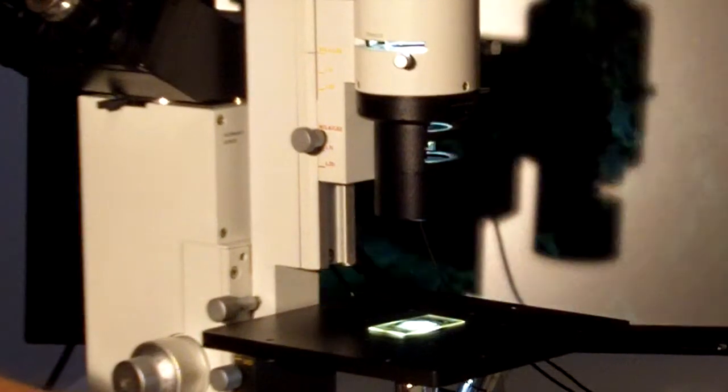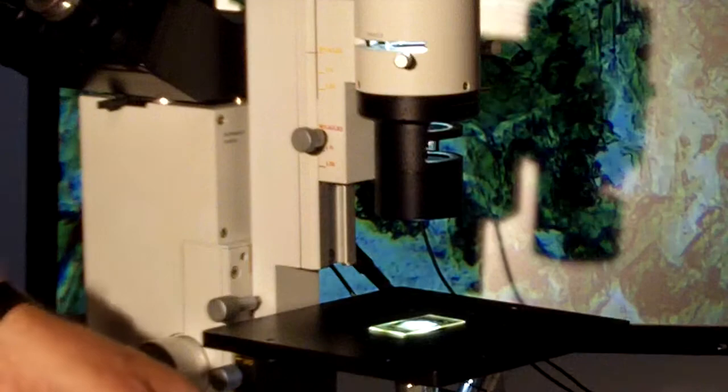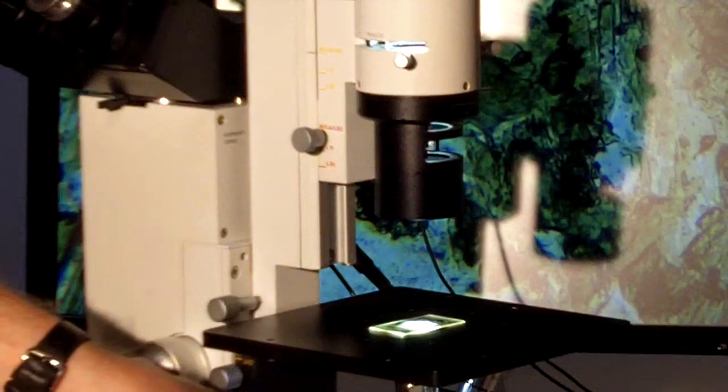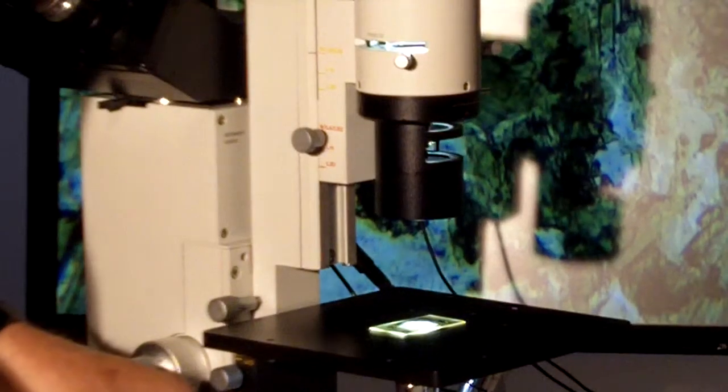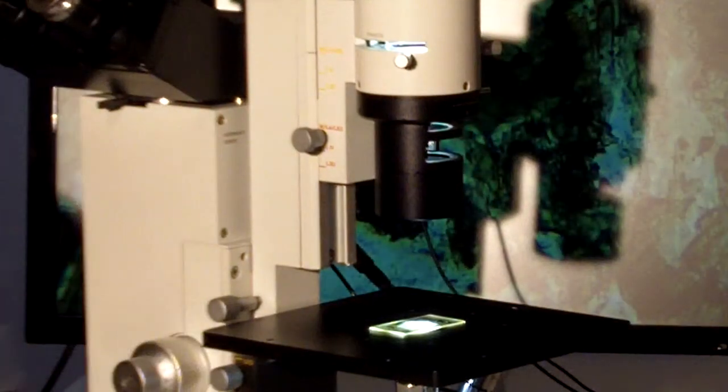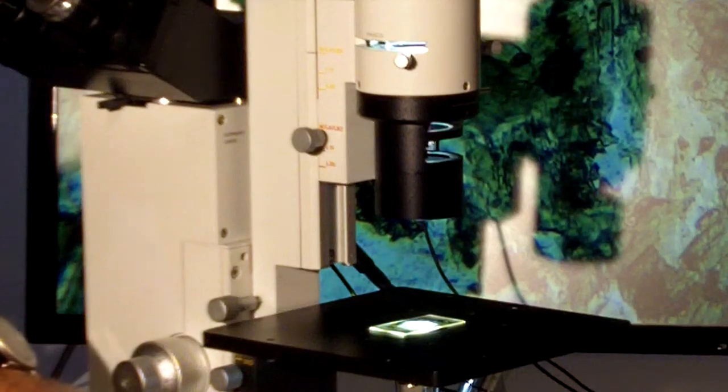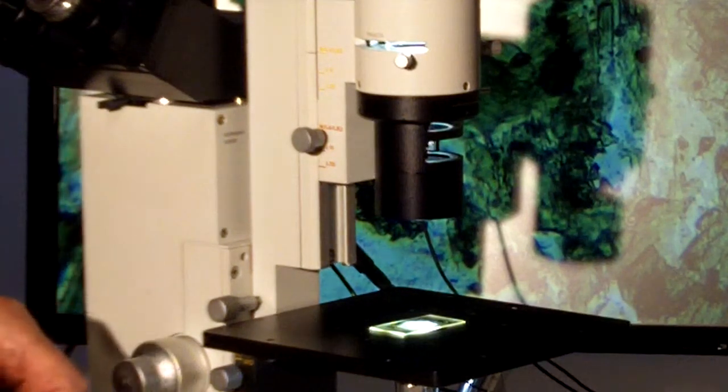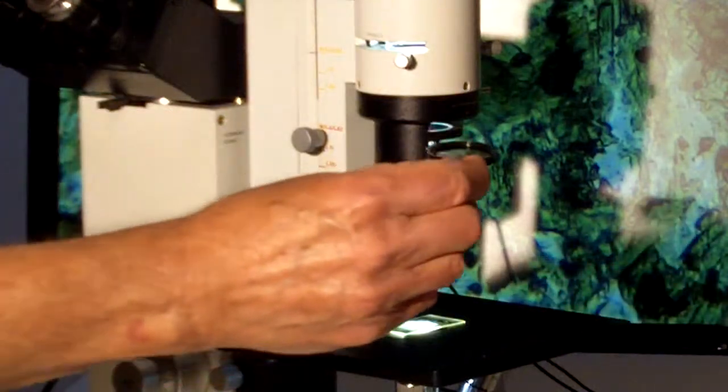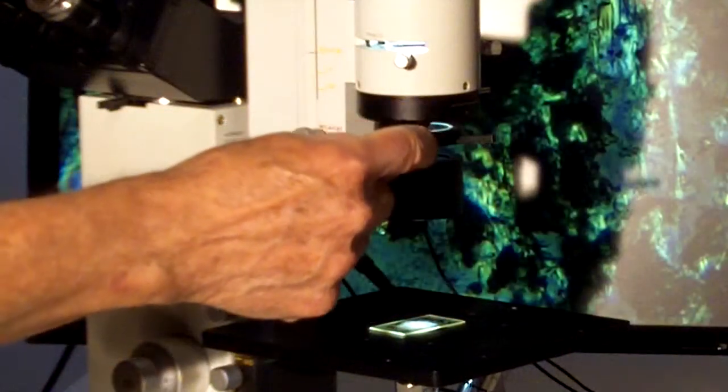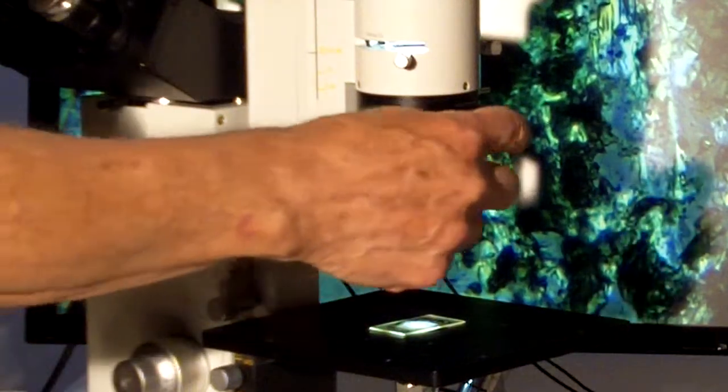Now the way we get cross polarization is to add what is called the polarizer. We have a nice convenient set of filter slots here to add three filters. And now we start seeing some things going on.